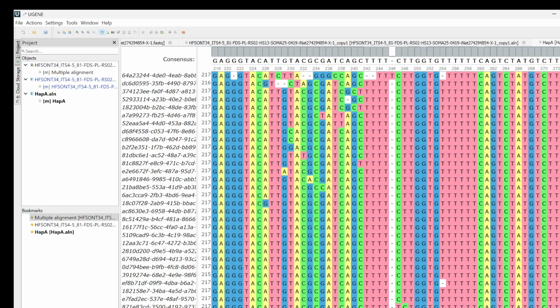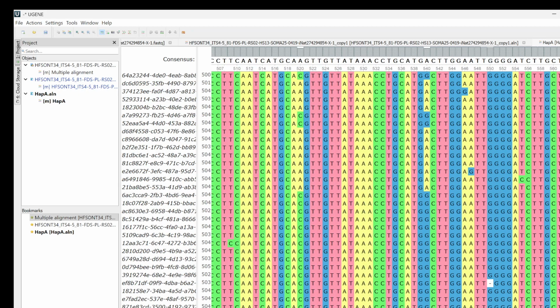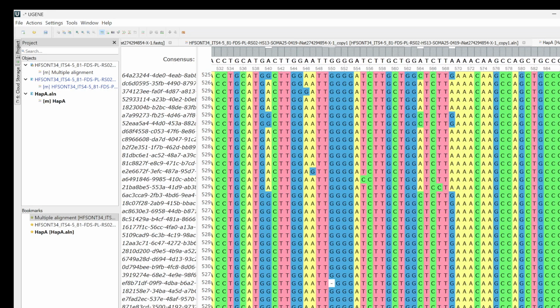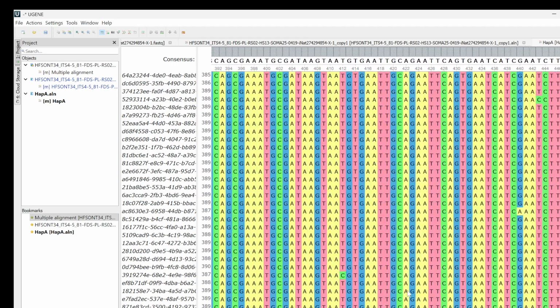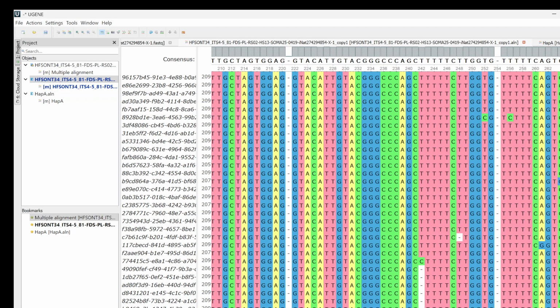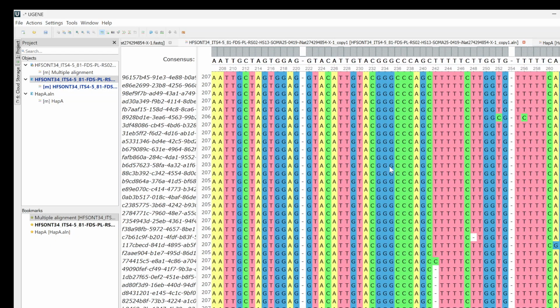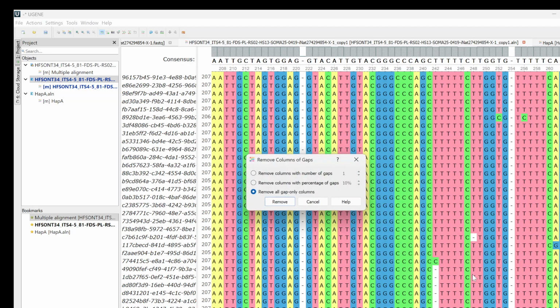We can still see there's a little bit of stuff going on here. It looks like just a couple columns of gaps, and then we've got just a little bit of background polymorphism happening. So there's probably more than 2 haplotypes. Let's take a look at what remains and see how this looks. So it looks like this remaining haplotype is pretty clean. Let's go ahead and just remove the columns of gaps again.